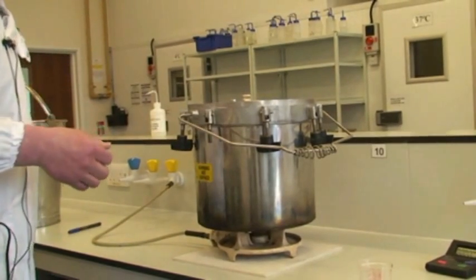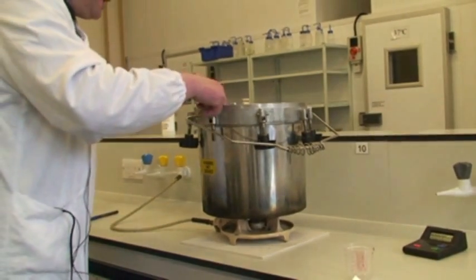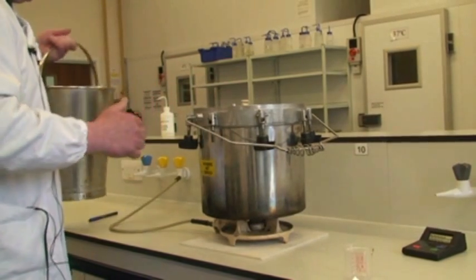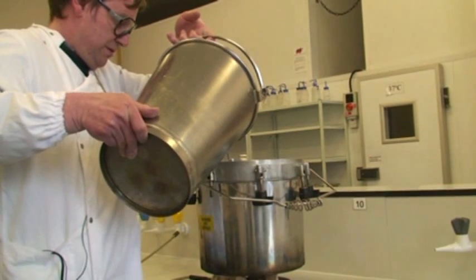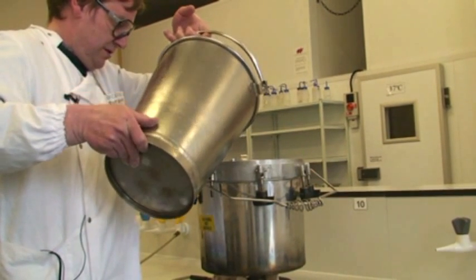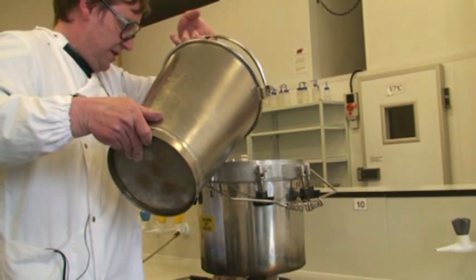The autoclave itself needs water in the base just above the pan inside, so I'll tip some water in there like that.